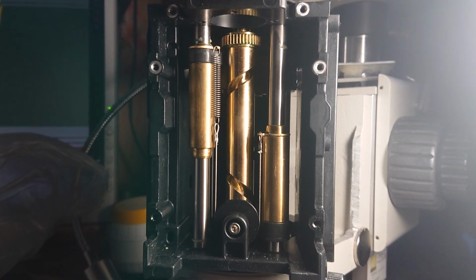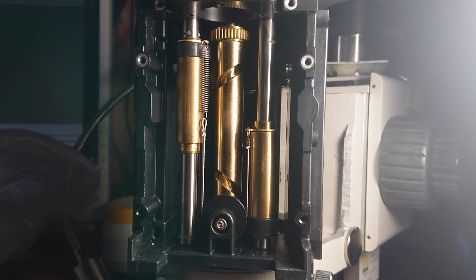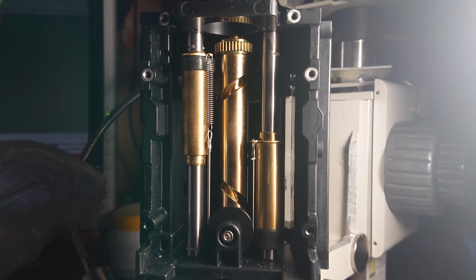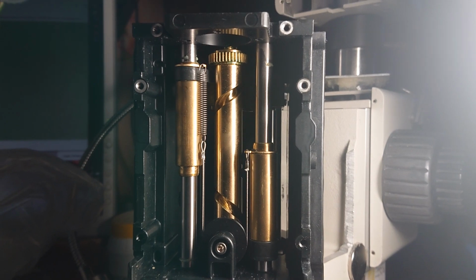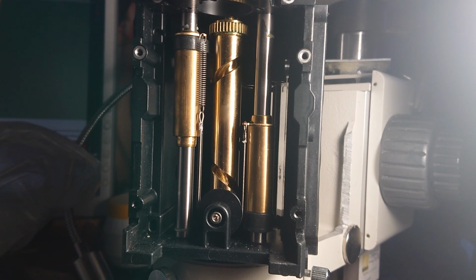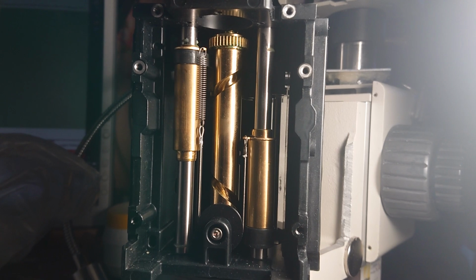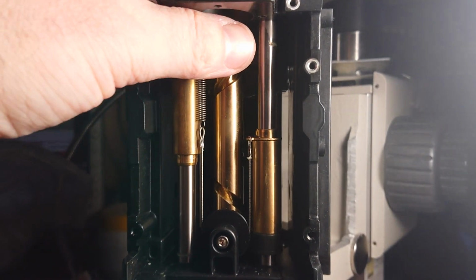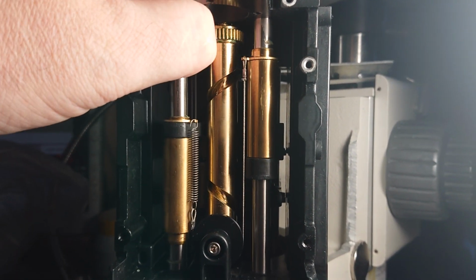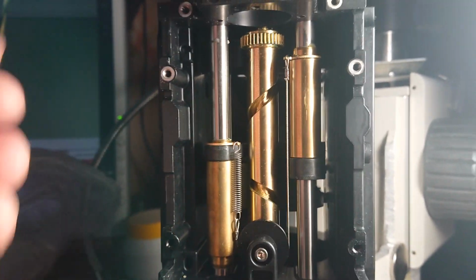Just for maybe a fluorescent way of filming or photo, and I don't know why it's separate technically, but it has its own prisms inside a special device. I have removed those electronic and motor driven parts, so now it's controlled with my hand here. And we'll try to see what is the alignment of exactly this one.